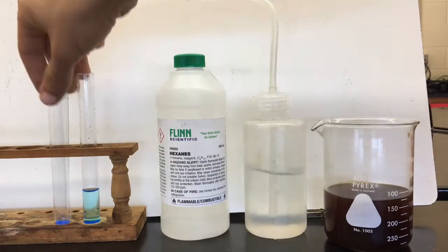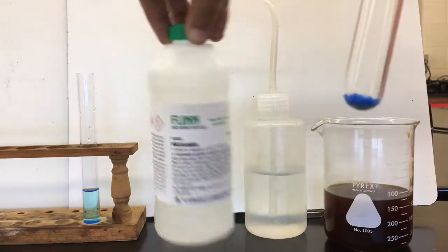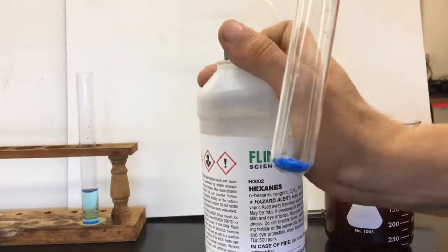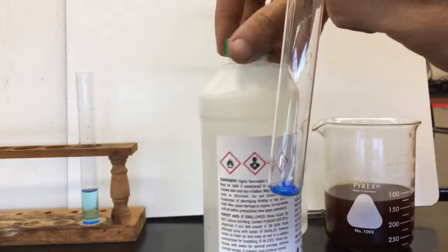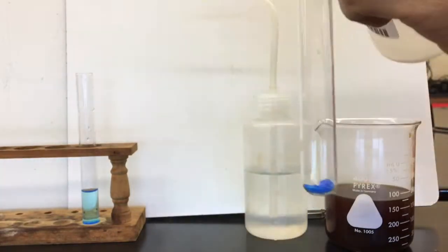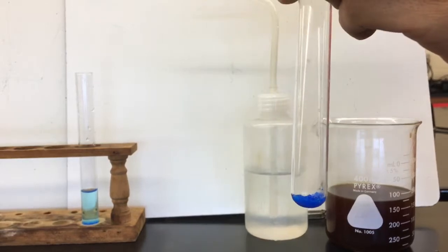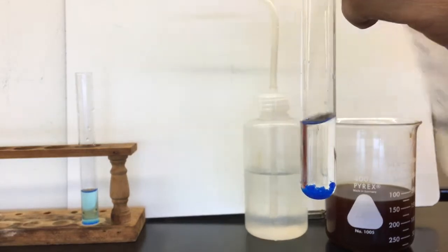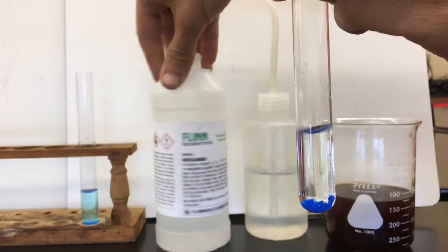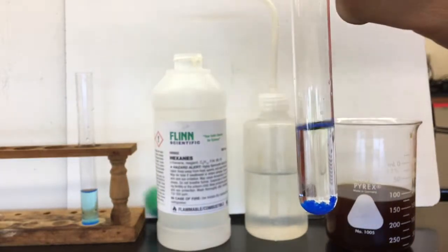We'll return that water to its home, and we'll add some of these hexanes to our other sample of the copper nitrate. Let's get the lid of that dude off. We want to keep the lid on the hexanes because they're pretty volatile, which means they'll evaporate and form a gas. You don't want to inhale a ton of hexanes.